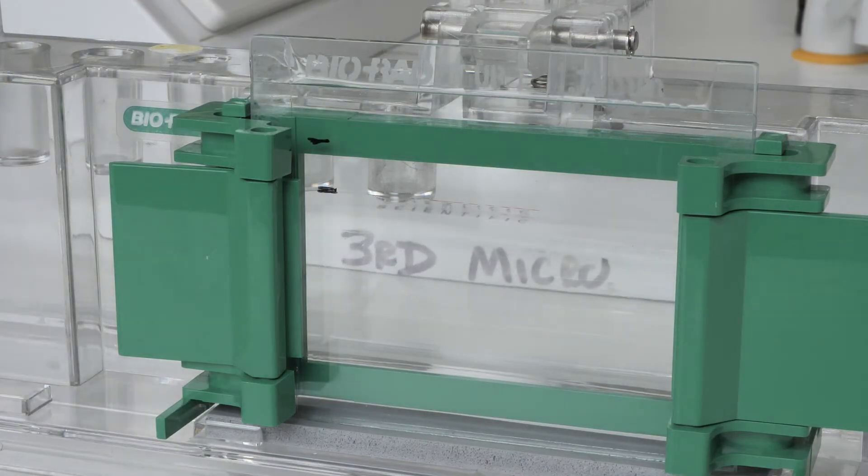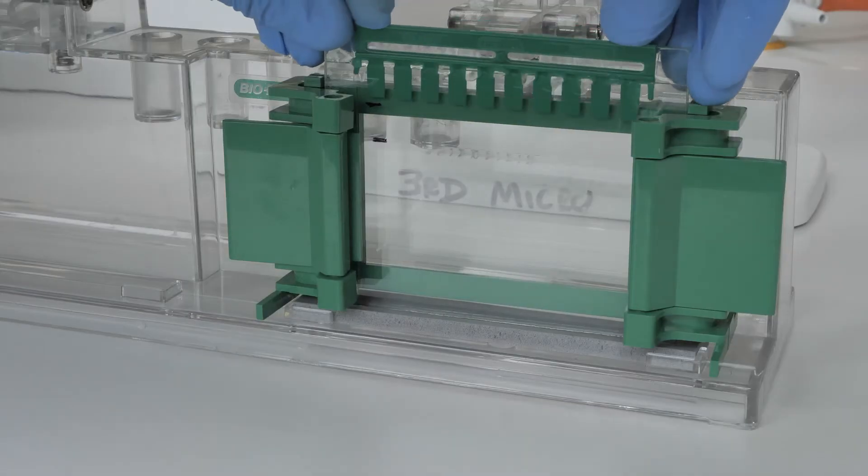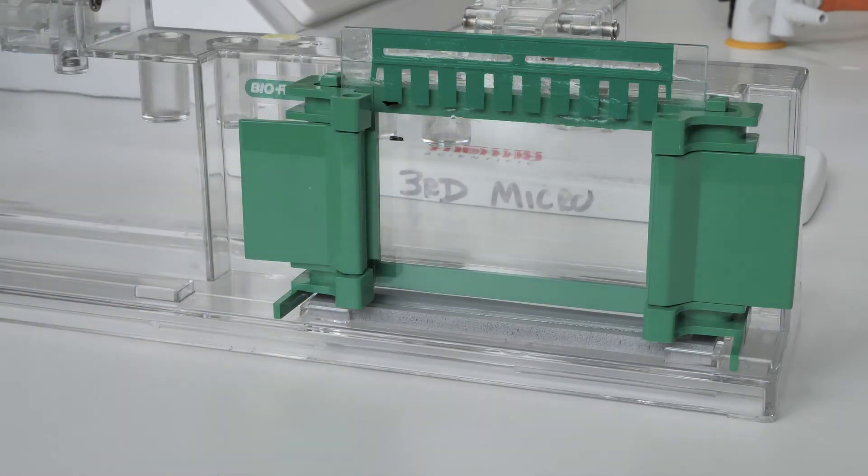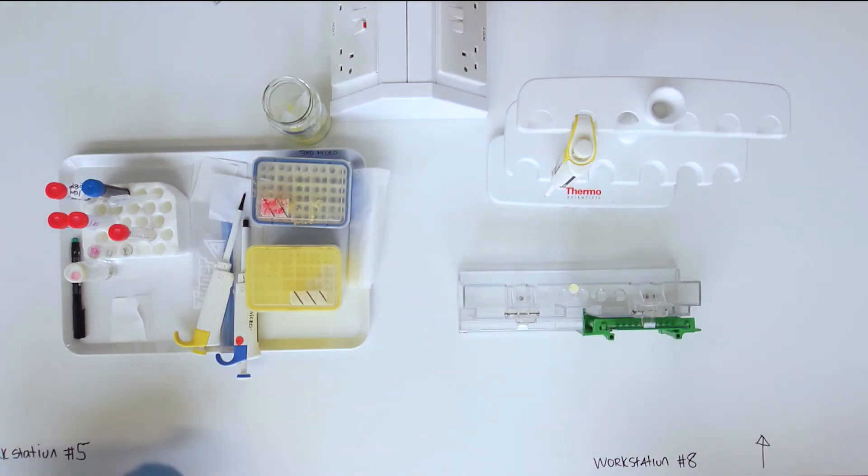Carefully insert the comb, ensuring not to capture air bubbles under the teeth. Allow the gel to polymerize, which should take approximately 15 to 30 minutes.